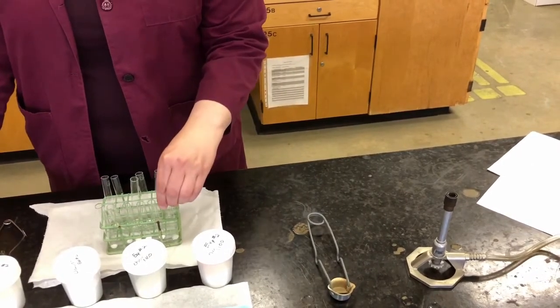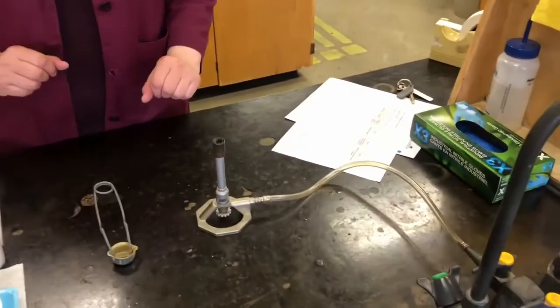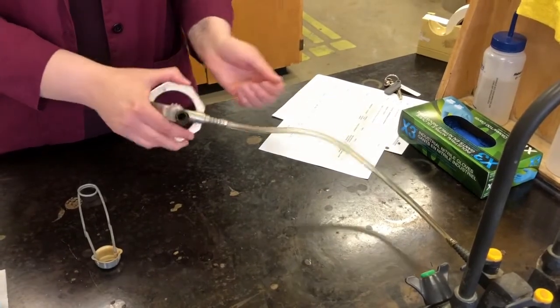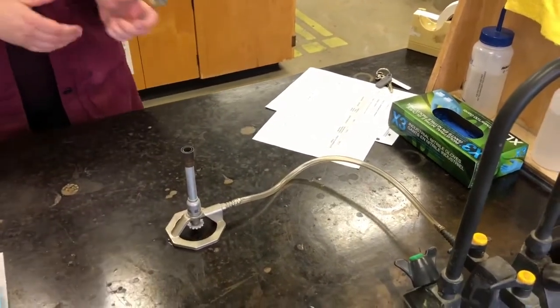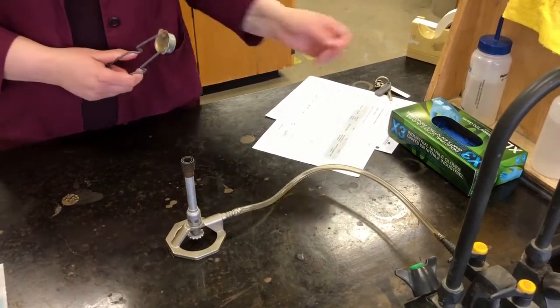We're going to heat them directly in the Bunsen burner flame. So the first thing we have to do is light our Bunsen burner. If you remember from the video on lighting a Bunsen burner, we have to open the gas valve about a full turn, open the air again to let some air into the flame, and check that our lighter works. This one works good. So now we're ready to light the flame.